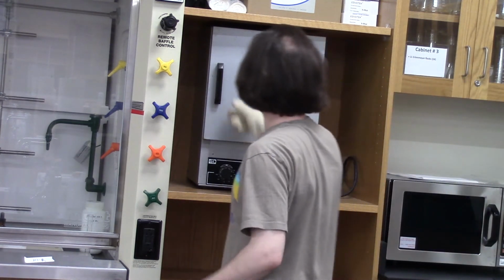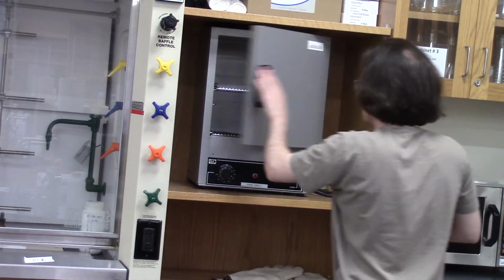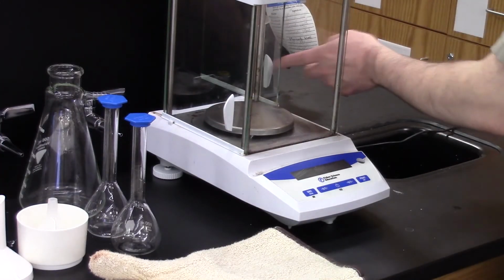After 10 minutes, the product is removed again. After weighing, the mass has not appreciably changed from the previous reading. This indicates that the water is all evaporated, and we're only weighing the solid that was collected with no residual water. All the data you'll need to complete this experiment can be found in the lab document. It will be up to you to use that information to calculate percent yield and all the steps you'll need to calculate to lead up to that.